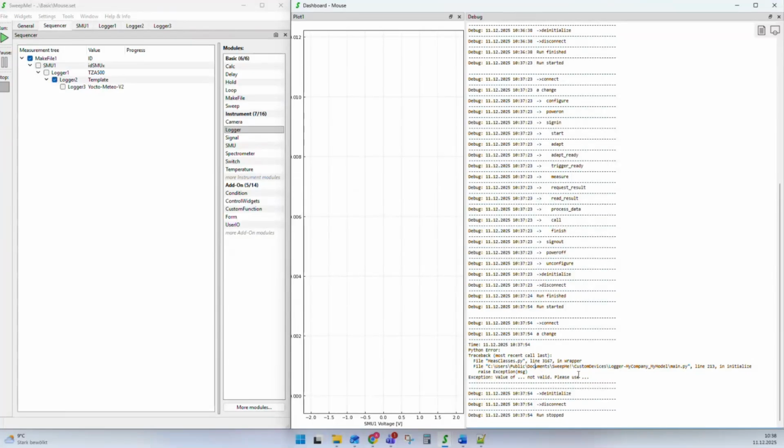This is just a small error because we created it. But if you use, for example, a library in your driver, and there is a complex error, you will find the complete Python error code in the debug. You can copy it and you can Google for the error, and you can use all the Python documentation to figure out why a library was raising an error.